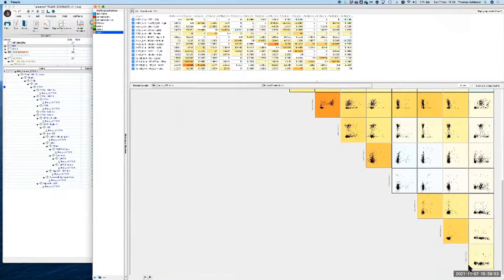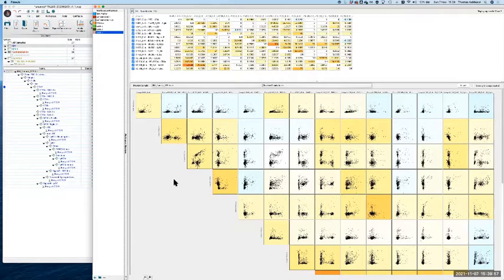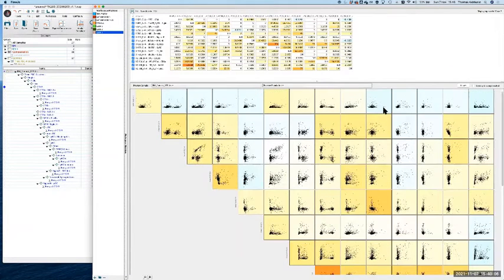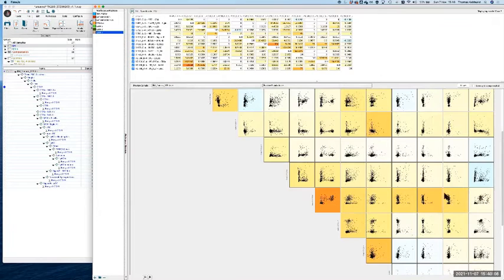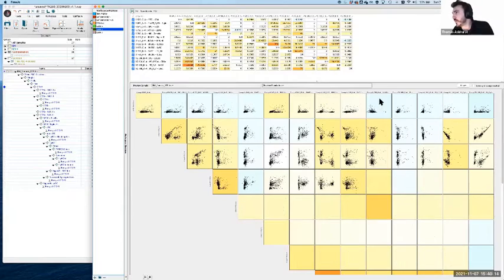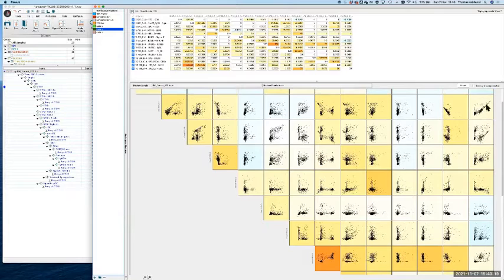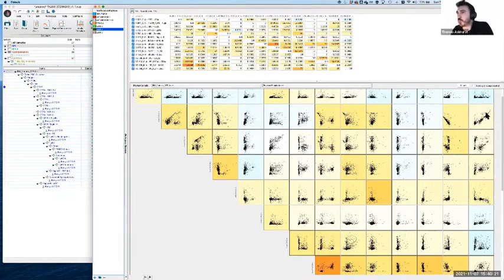I think if you go to your CD8 example that was overcomped, I don't know if that's easy to quickly pull up, but you could find it. Remember which one that was? It was a very thick line. Yeah. It was actually a very thin line. Go back to that, it should have been in 2, I think. Yeah, well, you can sort of see. So if you look, there's one of them at least.